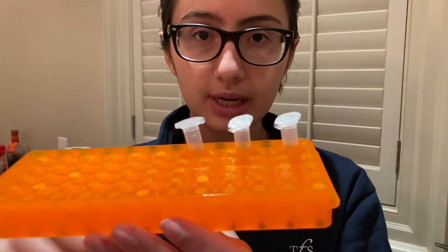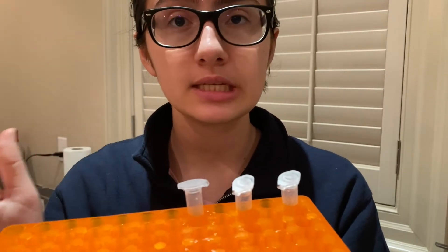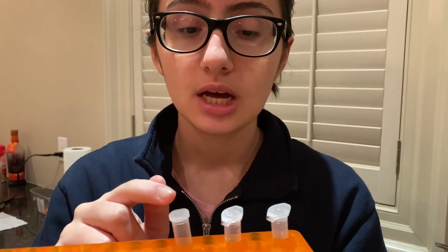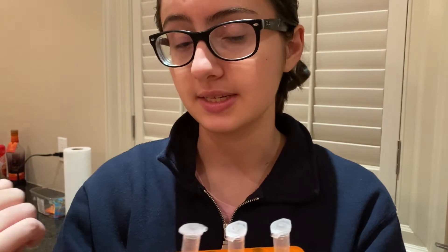I repeated this process for two more microcentrifuge tubes because I wanted to experiment three times. You can start right away, but I'm going to do my experiments tomorrow. If you're going to wait, store these centrifuge containers in the fridge at 4 degrees Celsius, and keep the rest of your bacteria in a warm area — about 37 degrees Celsius is preferable.